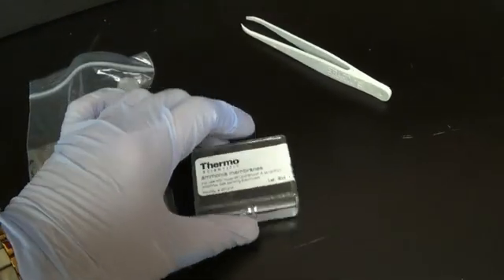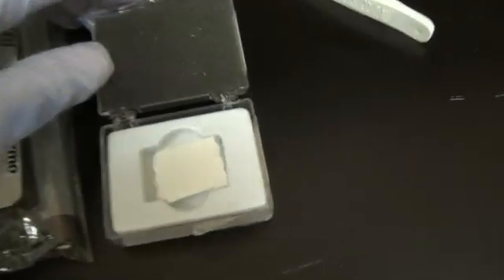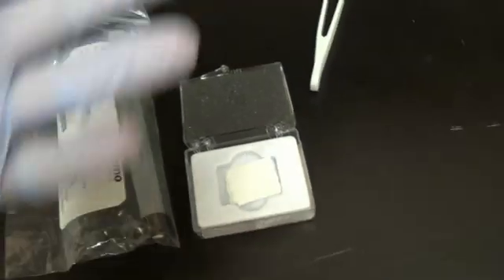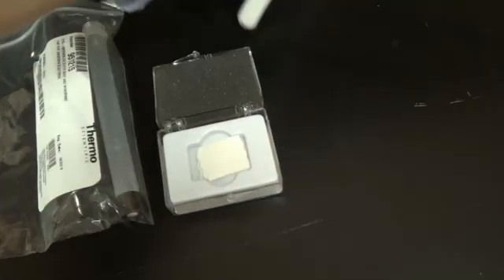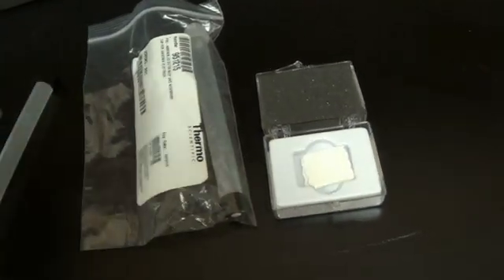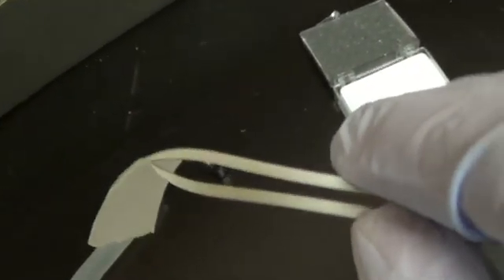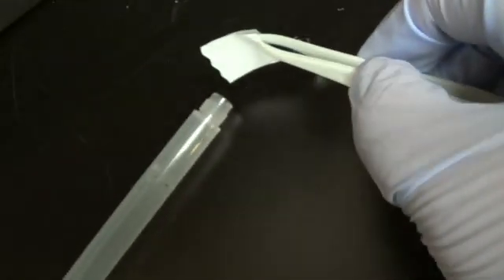So the membranes come in a little box like this. Very tiny. And you use gloves to put the membrane on and tweezers. So this is the fun part, grabbing the little membrane. It has a little bit of a wax paper separating them here. So I'm going to peel the membrane off. You see I got the little membrane off. And I am going to put it on here.